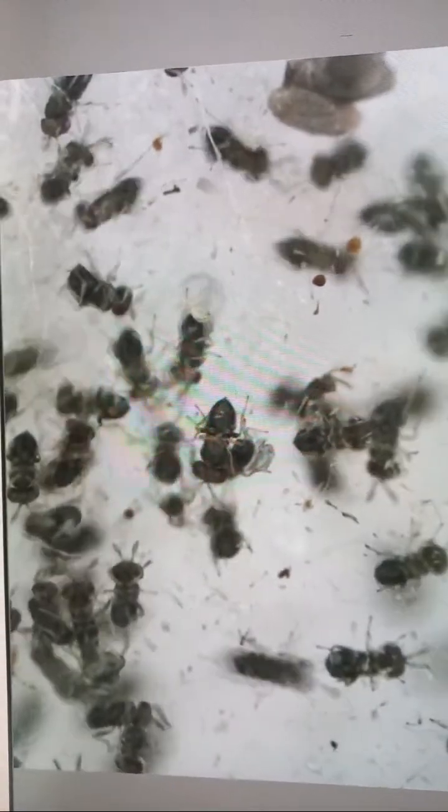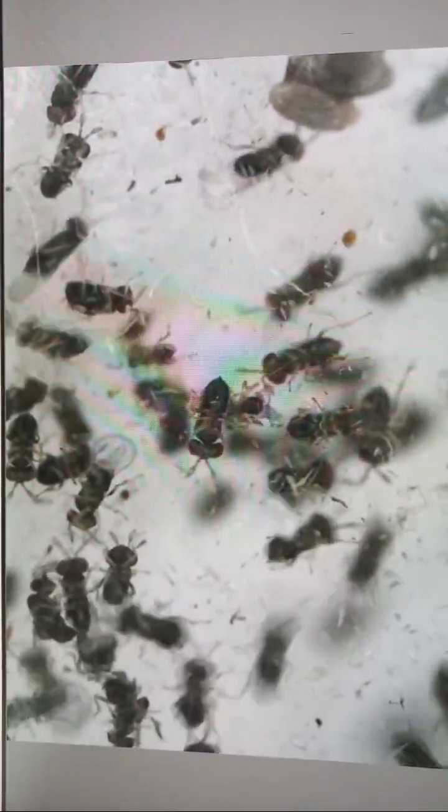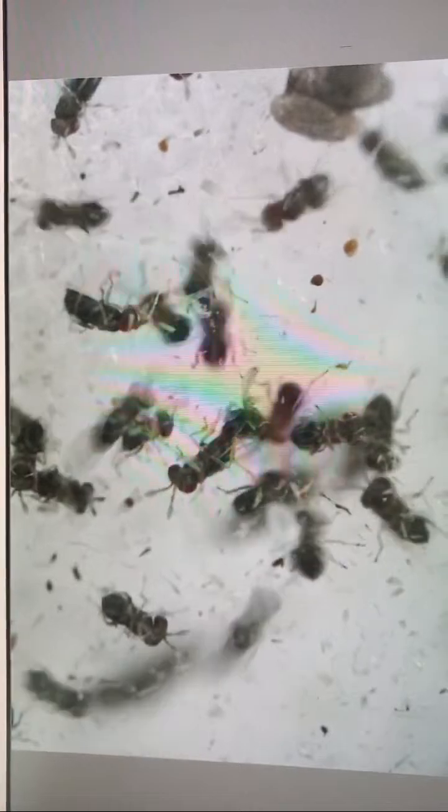But all these insects are crawling around and they are very small. These are tiny parasitoids, tiny parasitic wasps of a genus Trichogramma. They are belonging to family Trichogrammatidae. You can watch here males and females. In the central part, the male is mating with female, and others are crawling very fast because it's a very strong light under the microscope.